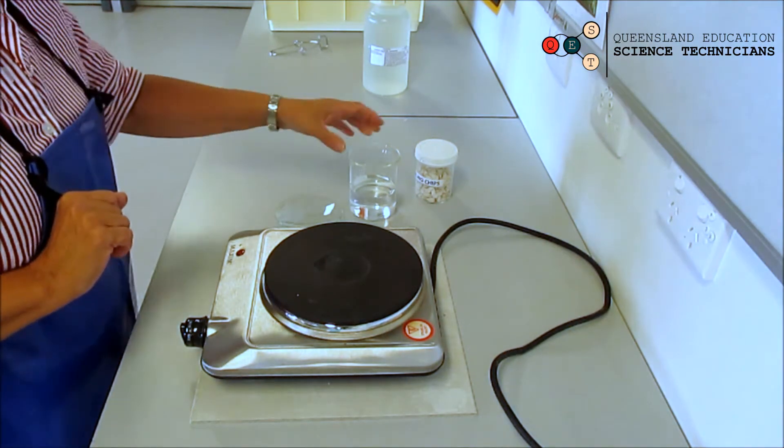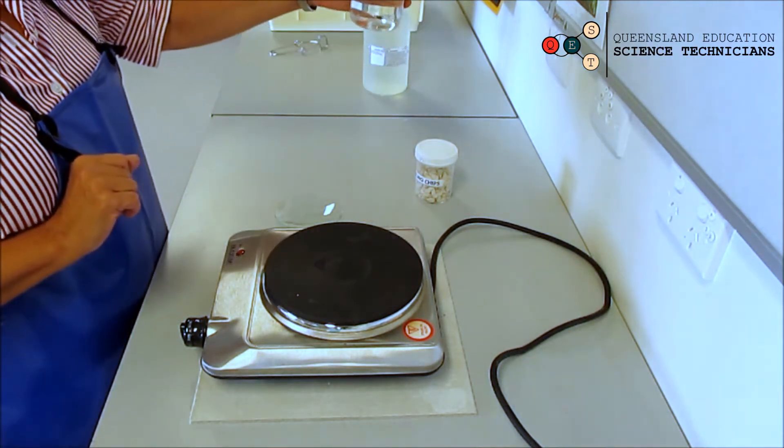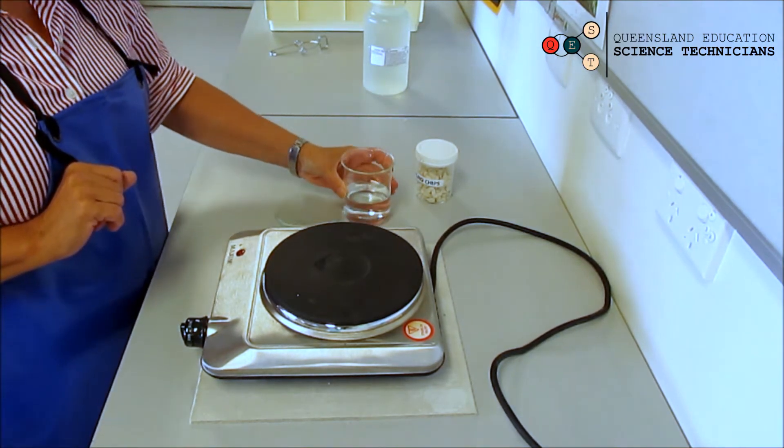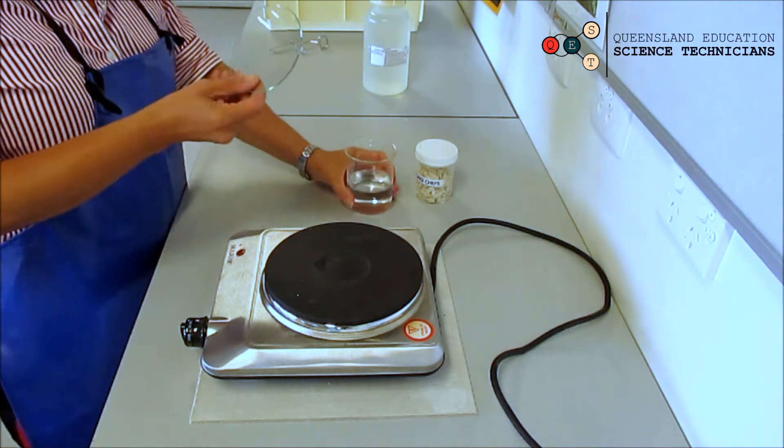Once you've done that, you put about 150 ml of warm water into your beaker.